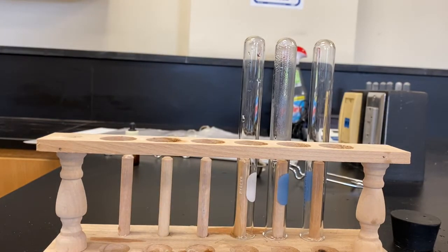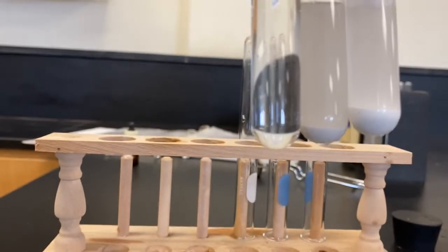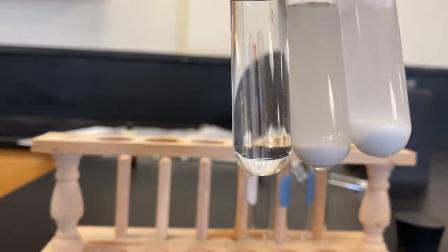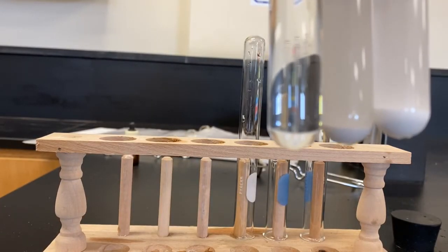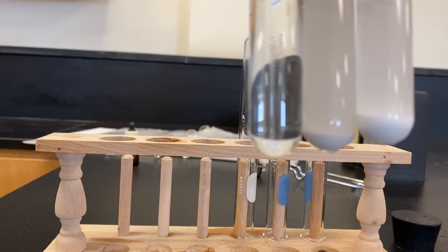What we want to do is compare the solubilities of each of those — magnesium on the left, calcium in the middle, barium on the right. You can see little piles of undissolved substance in the bottom of the calcium and the barium. So you're looking at which one dissolved most and which one dissolved least.